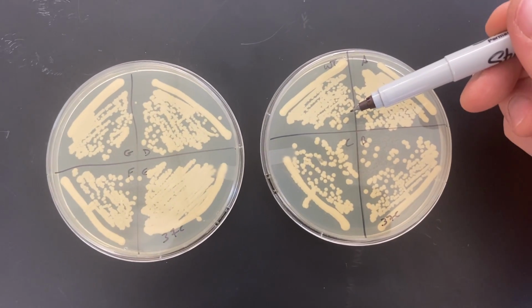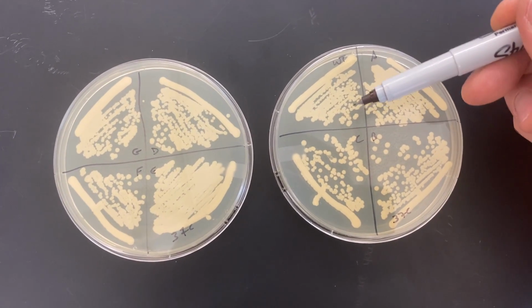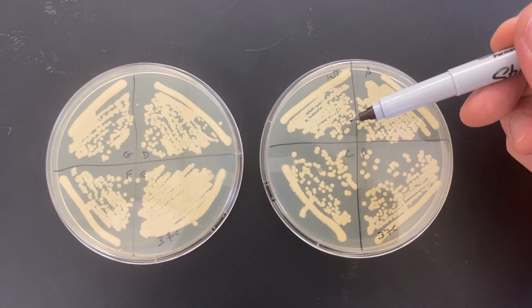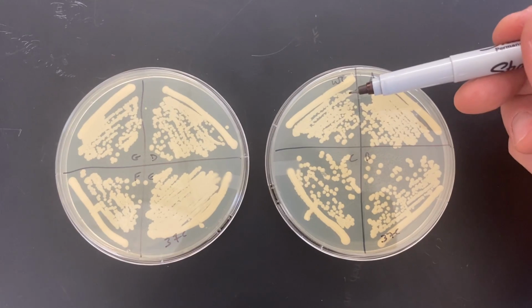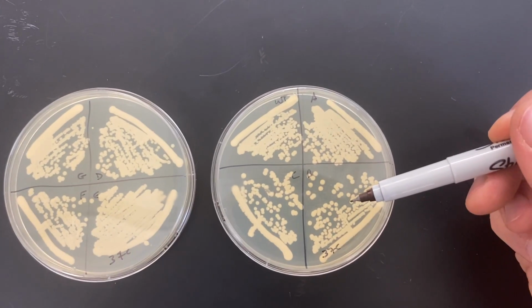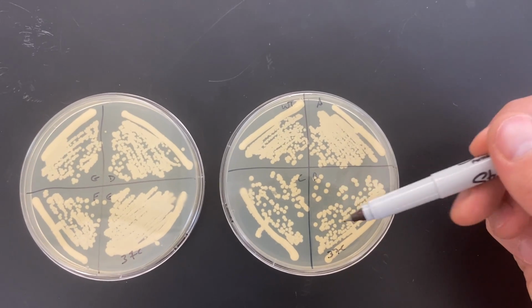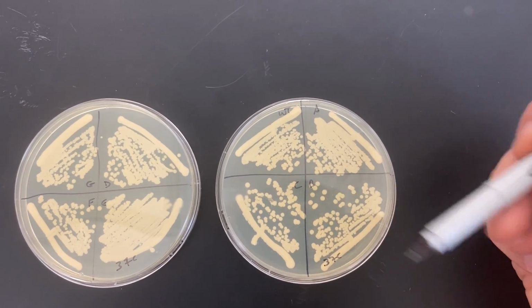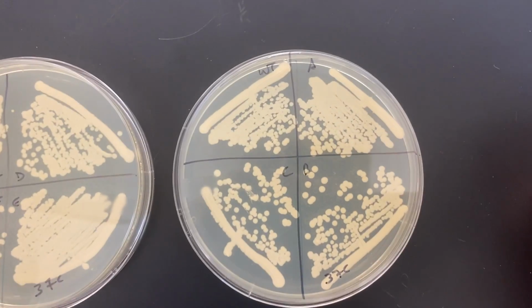I should give you a little caveat here, though, that yeast cells growing close to each other are going to exhaust the nutrients that are available in their vicinity. So this wild type streaking over here was a lot more cells than, say, across diagonally the B suspected mutant. These cells had more room and therefore more nutrients to take advantage of.